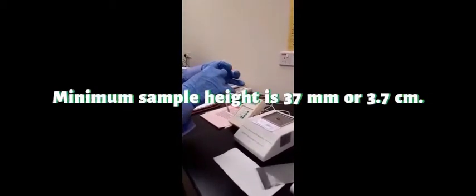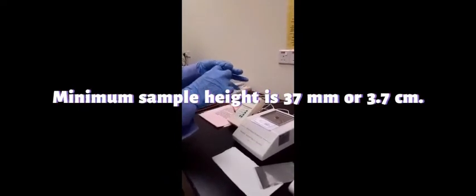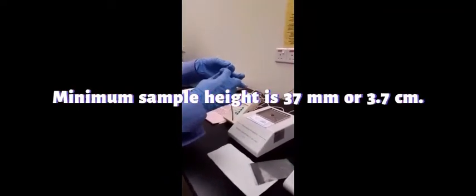Now remember, this is the compound that we prepared yesterday, manganese 3 acetylacetonate. By using a small thin spatula, we're going to insert this sample into the sample tube. The amount of sample that we insert in the tube should be a minimum of 37 millimeter height.